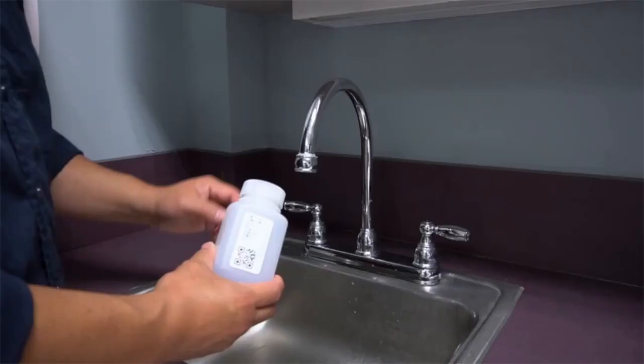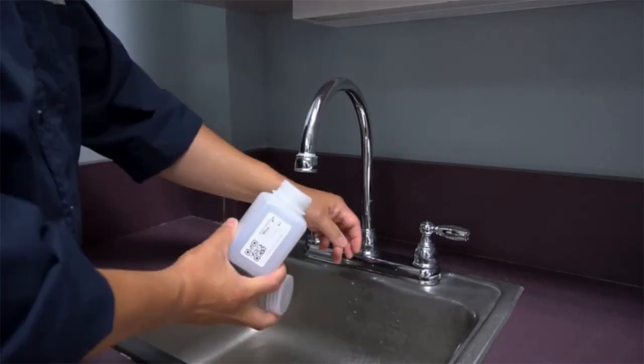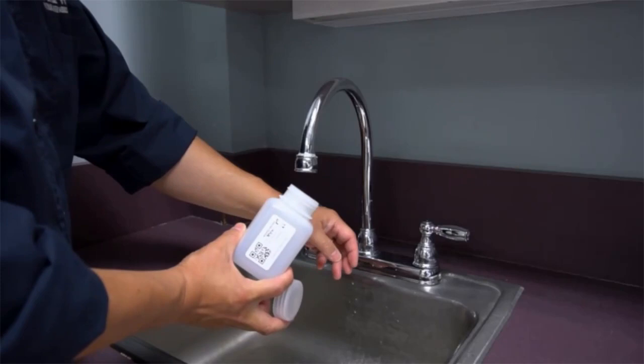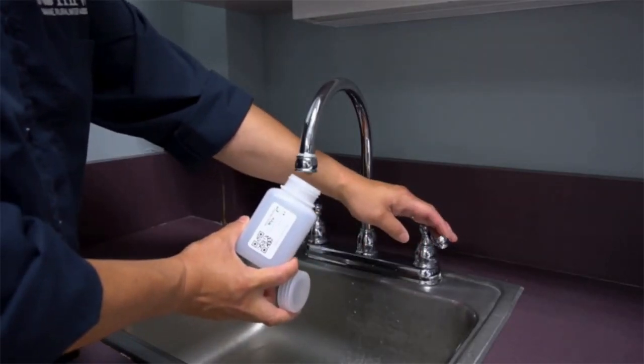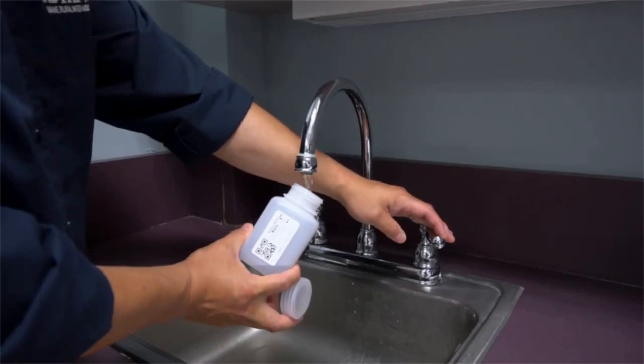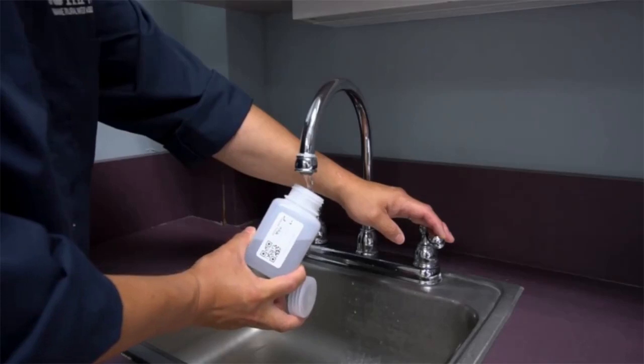The first investigatory sample you will collect is called a confirmation sample. It is collected under the same conditions as your initial lead sample, and its purpose is to confirm your original lead levels. To collect your confirmation sample, follow these steps. Remove the cap on the bottle. Hold the bottle in position under the fixture so water will flow directly in and turn on the tap. Fill the bottle all the way to the neck, leaving a little bit of room so that the lab can add preservative.